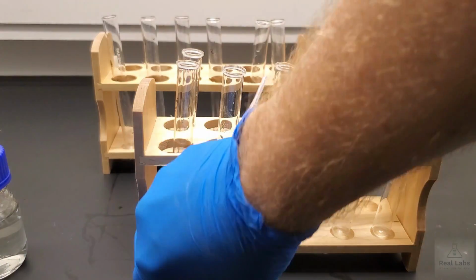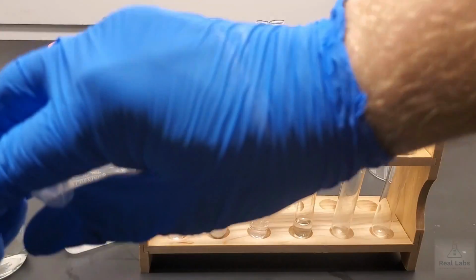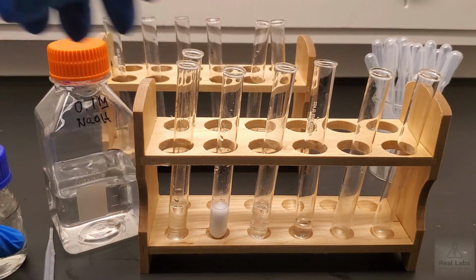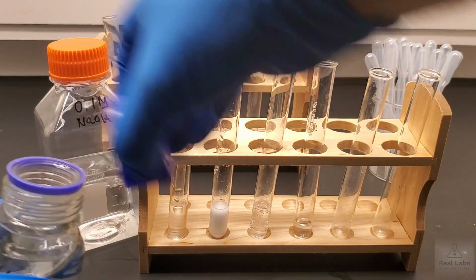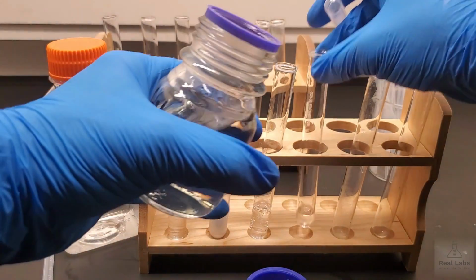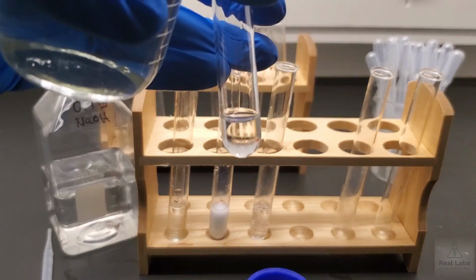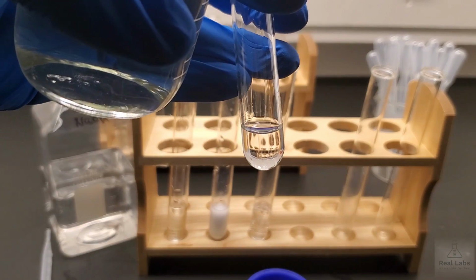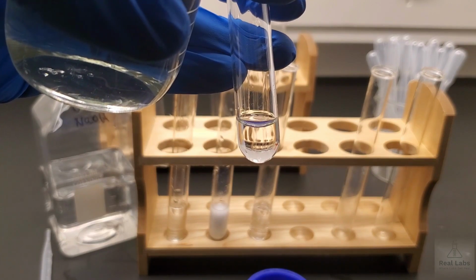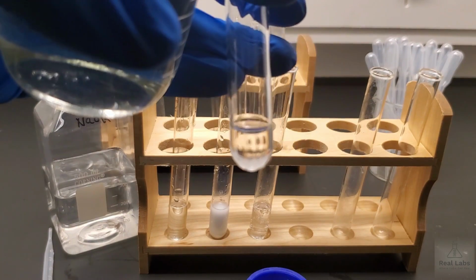Put the lid back on the container, and then we'll get the HCl, and we'll try to keep that test tube in shot as we add the HCl. So I'm using the same method as I was a few minutes ago. The mouths are close together. I'm just adding this on the side so you can see it better.